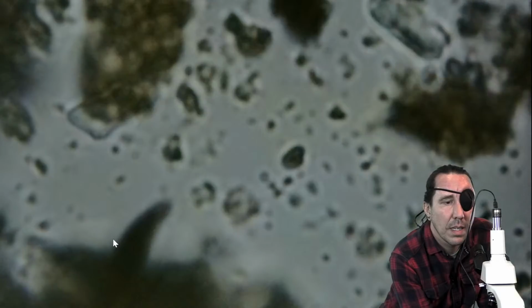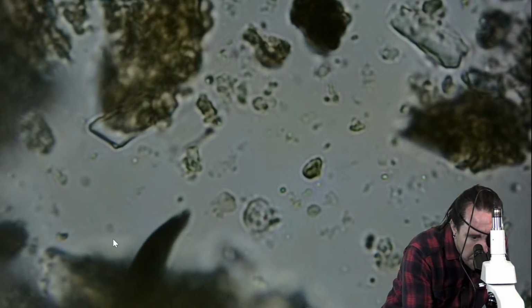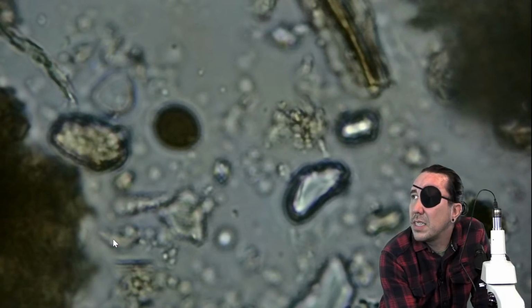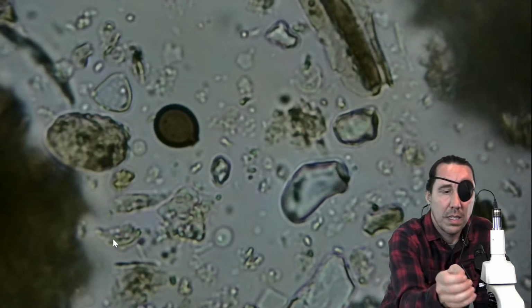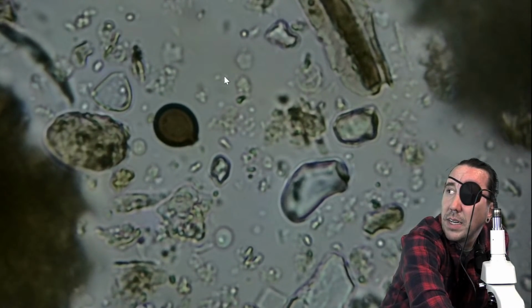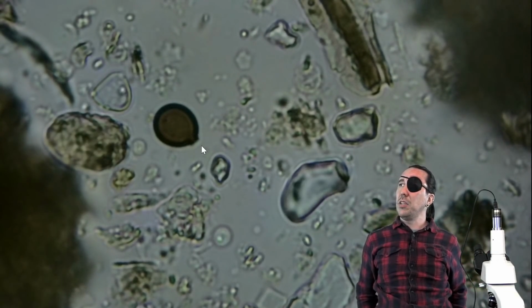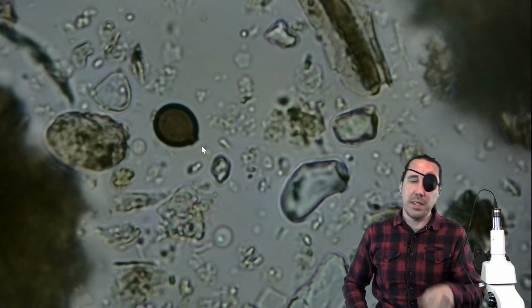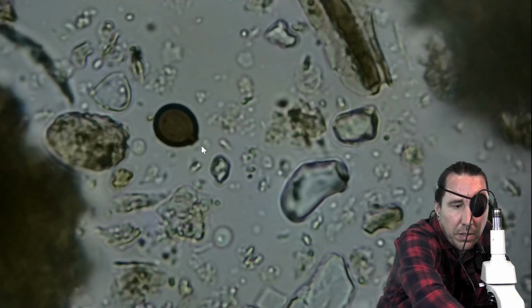I felt like at first we were seeing a whole lot, and then lately there's just not much coming up. Here we go. Here's a testate amoeba, right here. So this one, I said there's some that look more like a balloon shape, more than an olive shape, and this has got that round shape and then a little tiny neck at the bottom, kind of like a balloon.